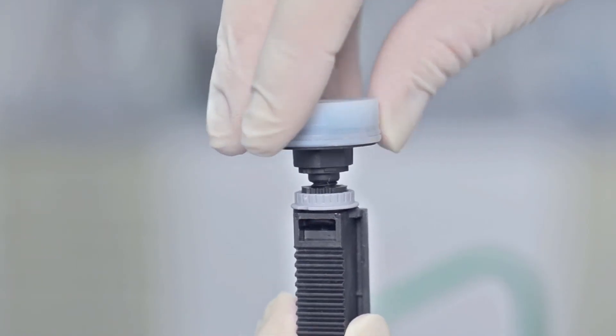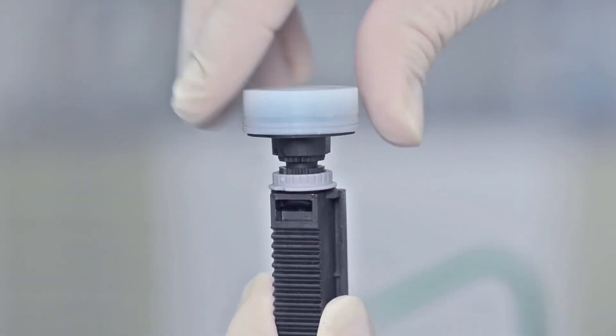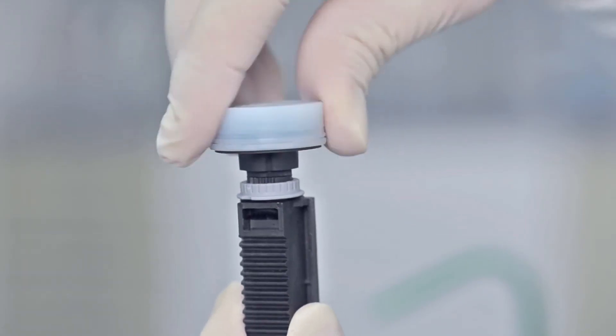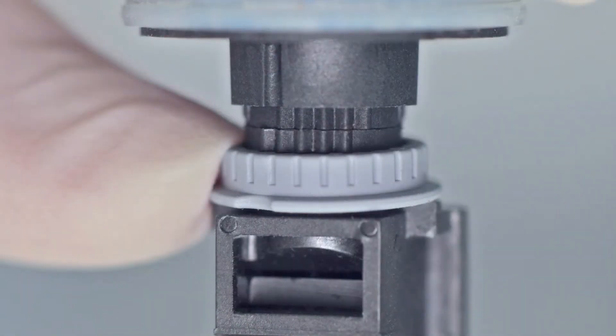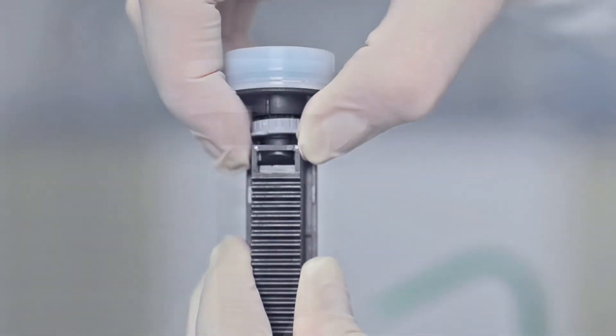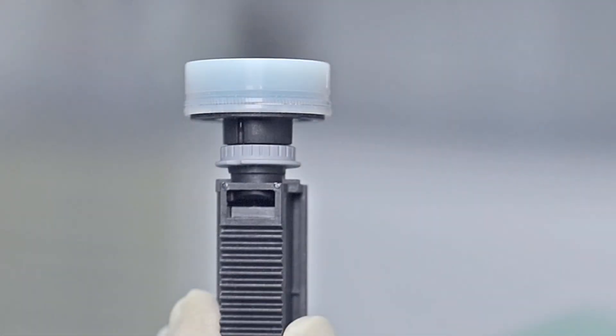Screw the clean piston onto the piston rod and tighten it securely. The teeth for the piston and the piston rod must be aligned. If necessary, the piston can be moved back by a maximum of one tooth. Then slide the safety ring upward again.